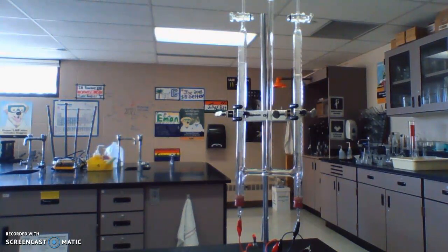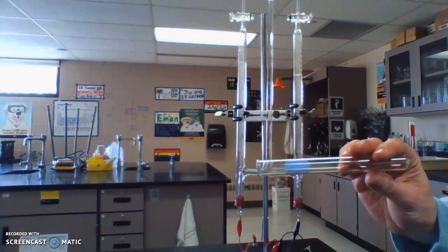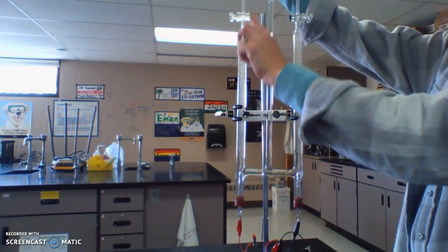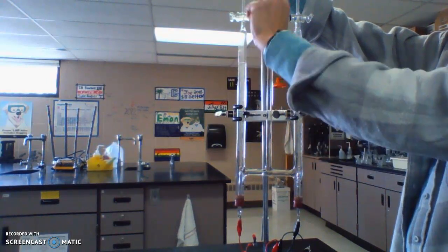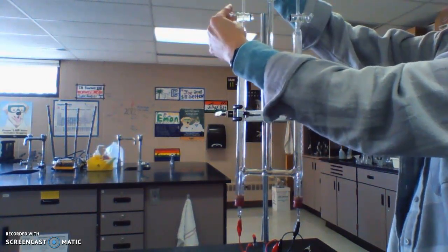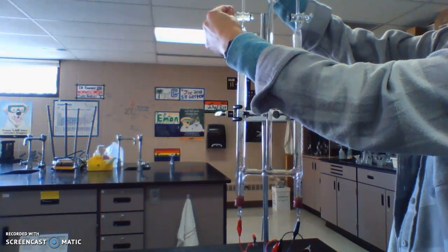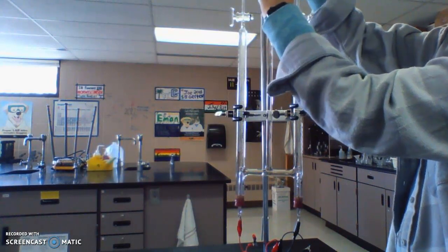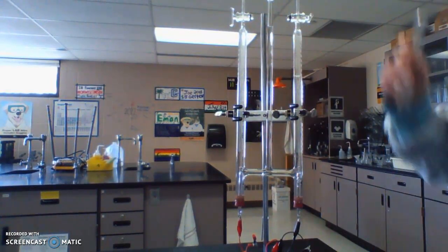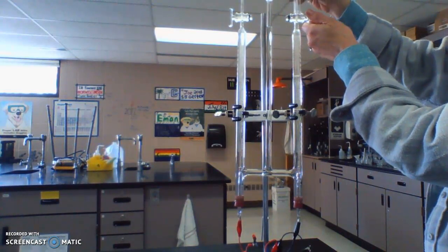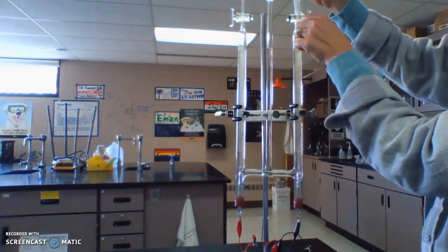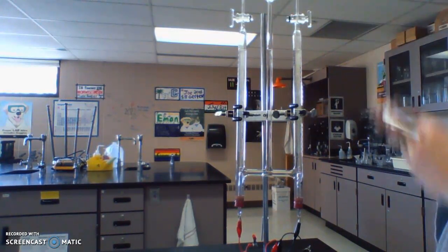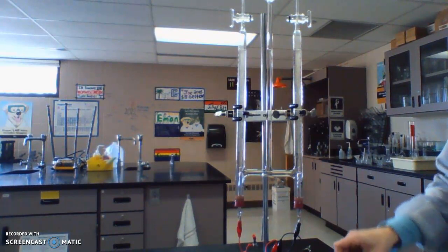I'm going to collect them in test tubes. All I have to do is turn the little knob here and these gases will go up and into the tube. I'm going to collect the oxygen first, go all the way up there, and then I'll collect the hydrogen.